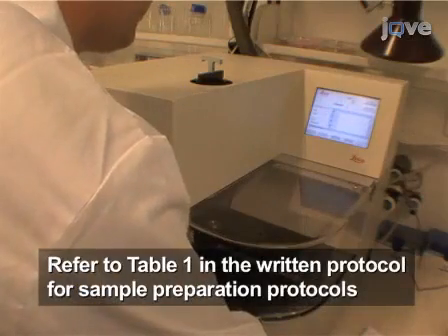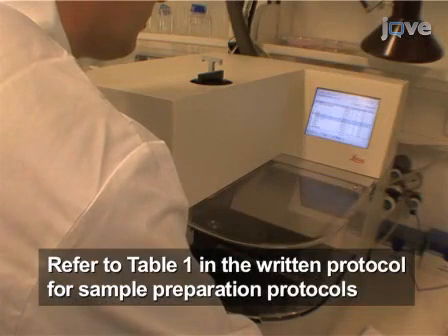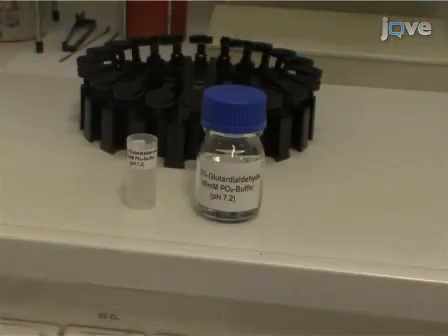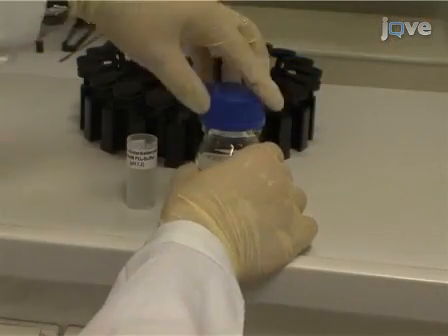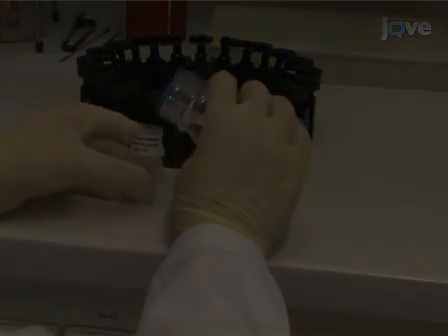Before the start of sample preparation, program the automatic microwave tissue processor for electron microscopy, Leica EM-AMW, with the appropriate protocols. Prepare the solutions for the different steps described in the programmed protocol for fixation, dehydration, and infiltration.